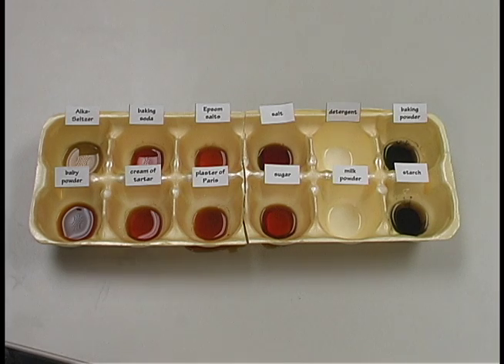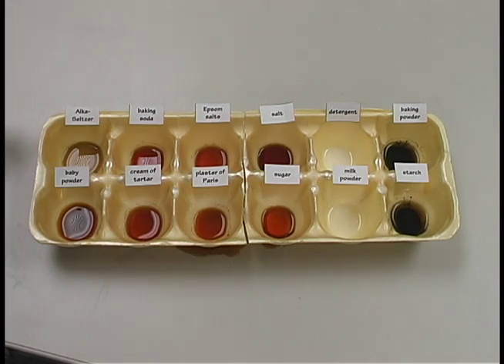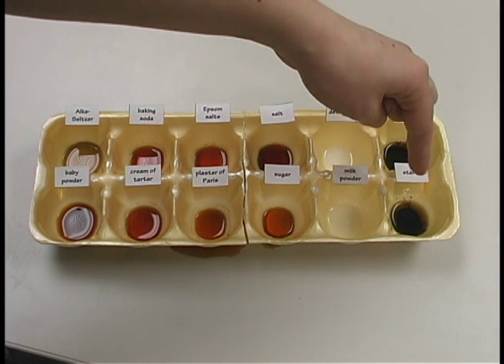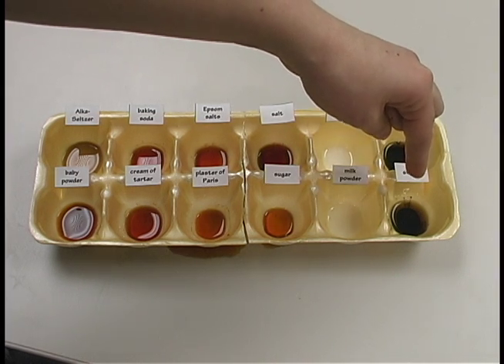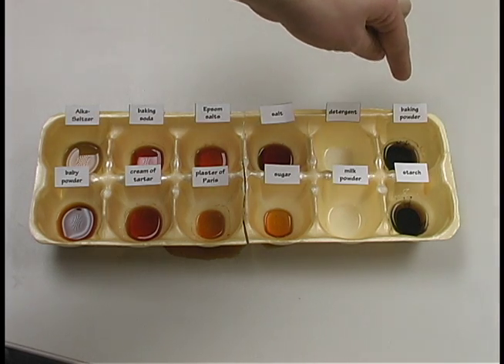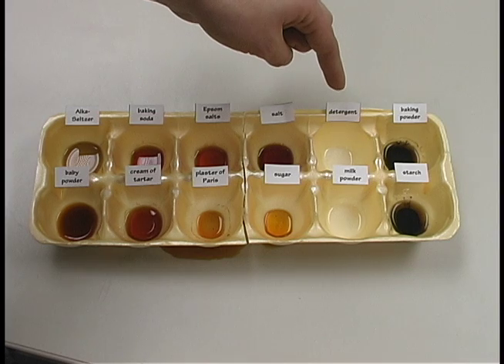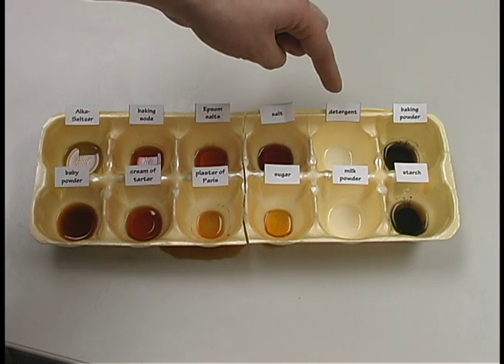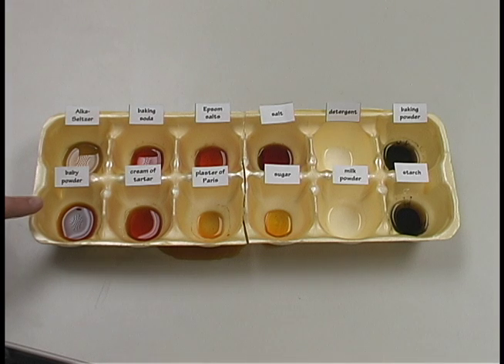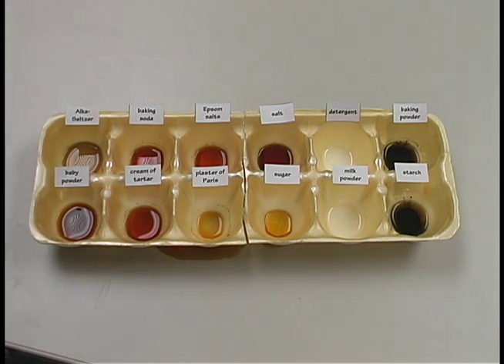Here are the results for the iodine test for all 12 powders. Starch causes the iodine to turn a blue or black color. Baking powder has starch in it so it shows the same result. Detergent and milk powder take the color out of the iodine so it's clear. These six as well as baby powder do not react so they don't change colors. And Alka-Seltzer bubbles.